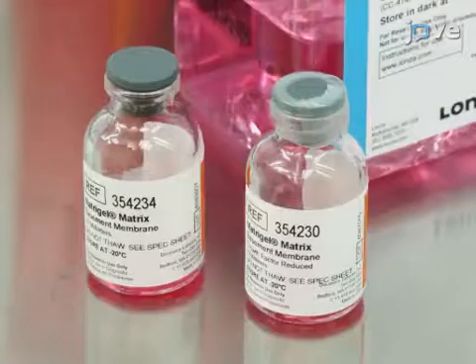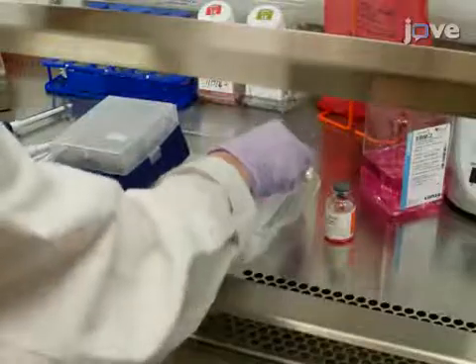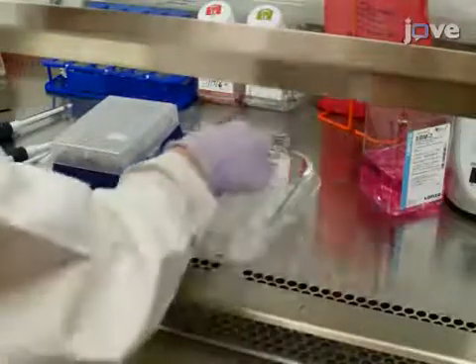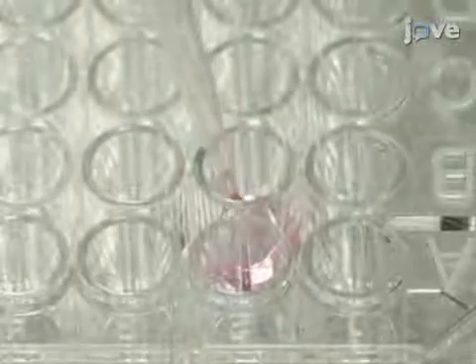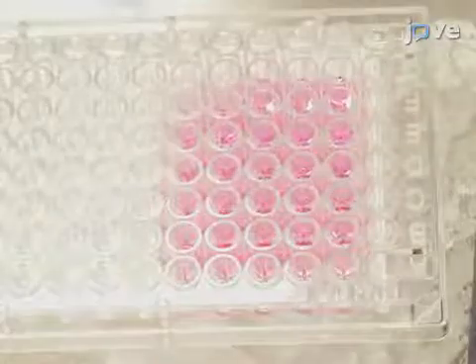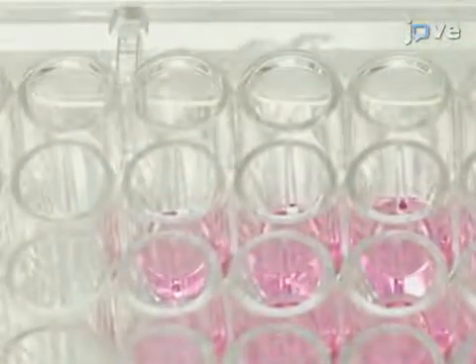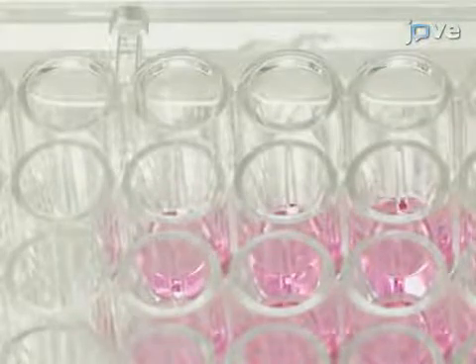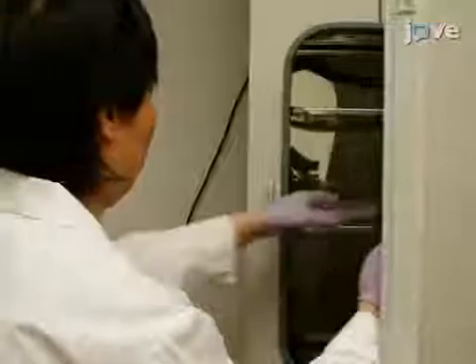To begin this procedure, thaw either GFR extracellular matrix or normal extracellular matrix overnight at 4 degrees Celsius. Keep the 96-well culture plate on ice and add 50 microliters of chilled extracellular matrix per well using pre-cooled pipette tips. Prepare triplicates of 5 wells containing only the normal extracellular matrix followed by triplicates of 5 wells containing only GFR extracellular matrix. Then incubate the plate at 37 degrees Celsius for 30 minutes.